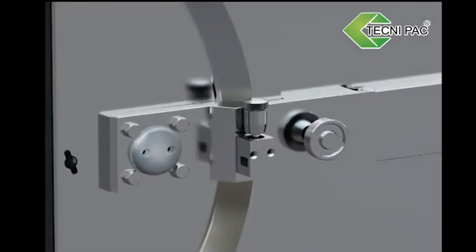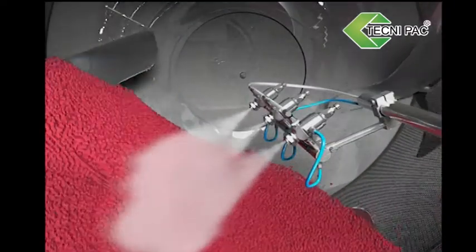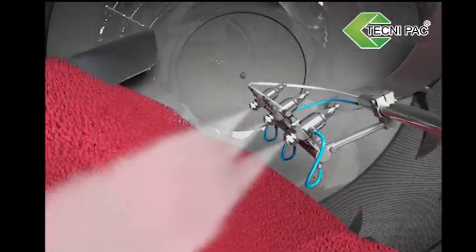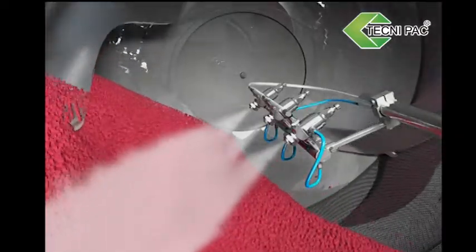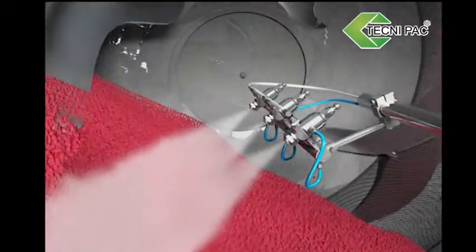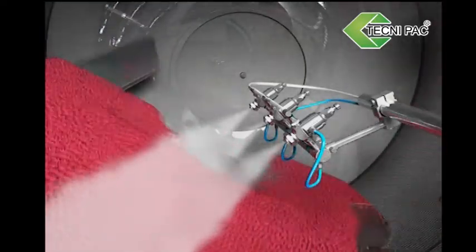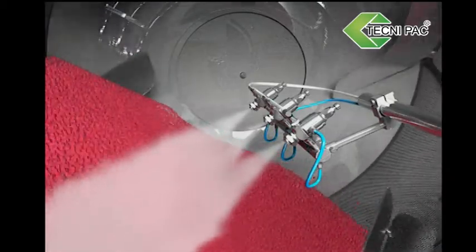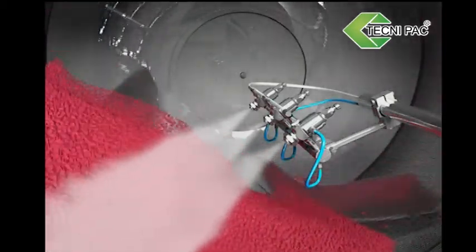Open coating machine and spray slurry at the same time. There is 2 to 4 turns per minute at step rotate speed. After 5 to 30 minutes, surface will form film and speed can go up to 6 to 9 turns. Then the flow also will be quicker. At last the flow is reduced to spray uniformly according to the coating technology and the quality of the tablet surface.